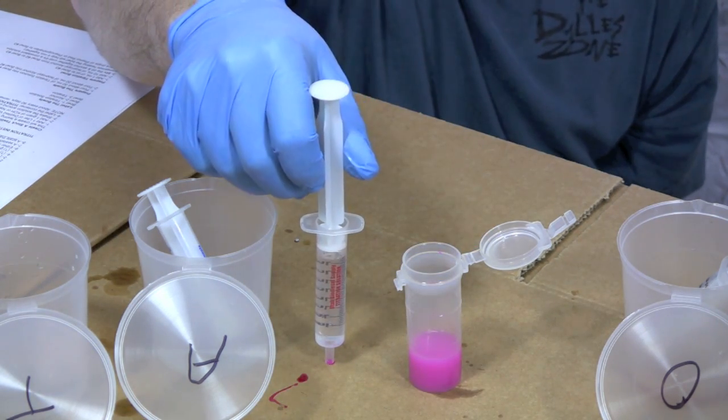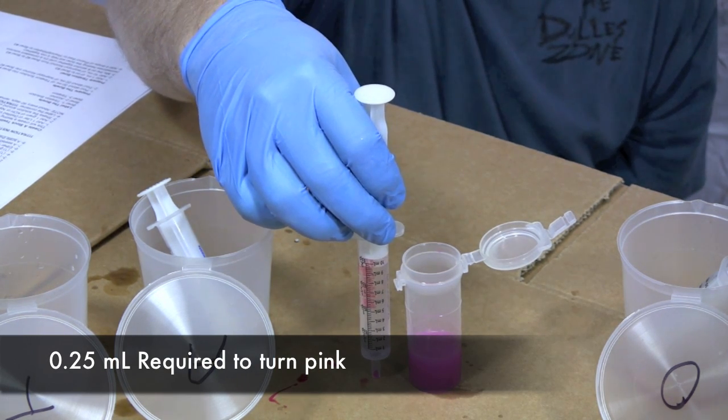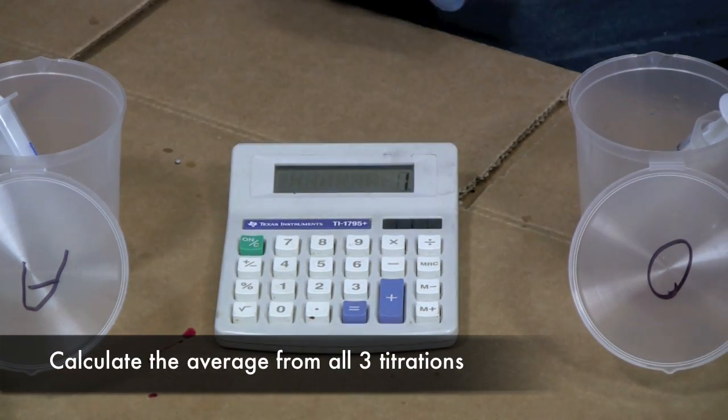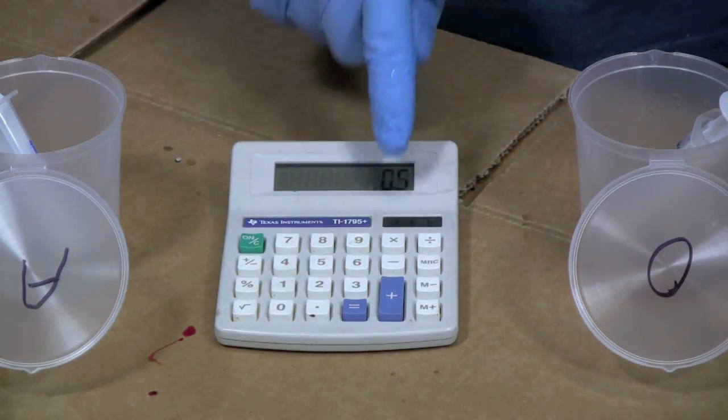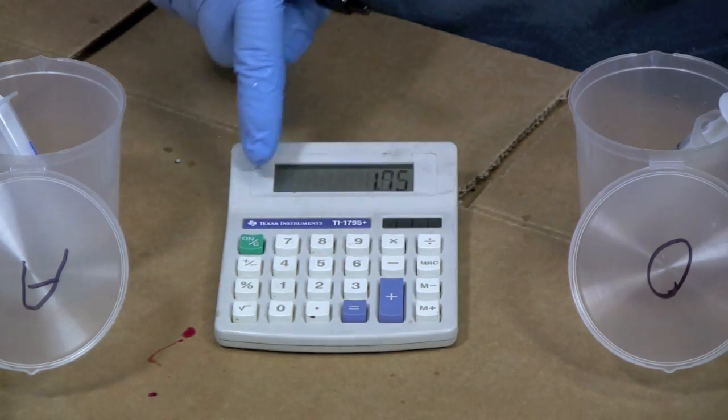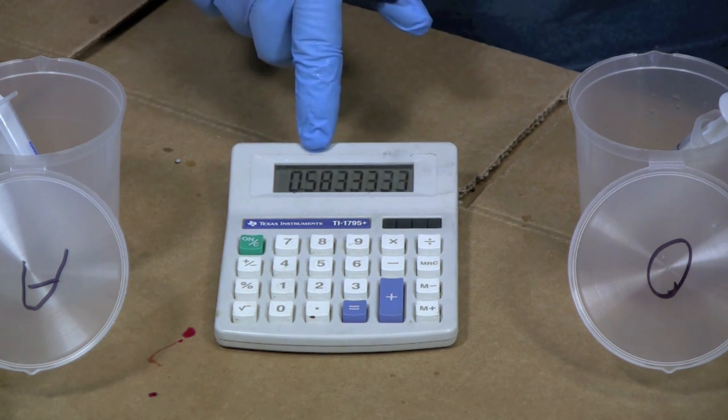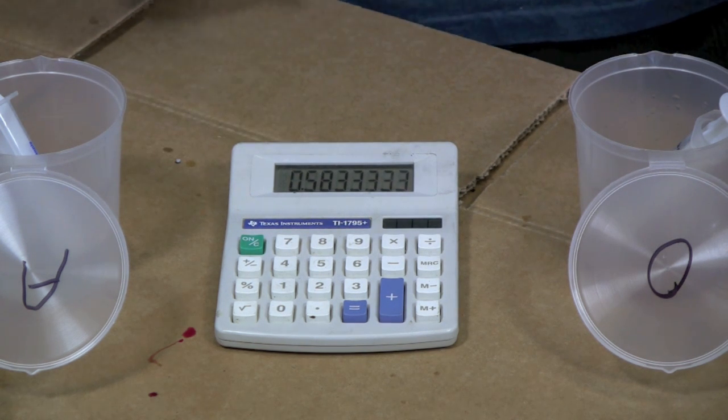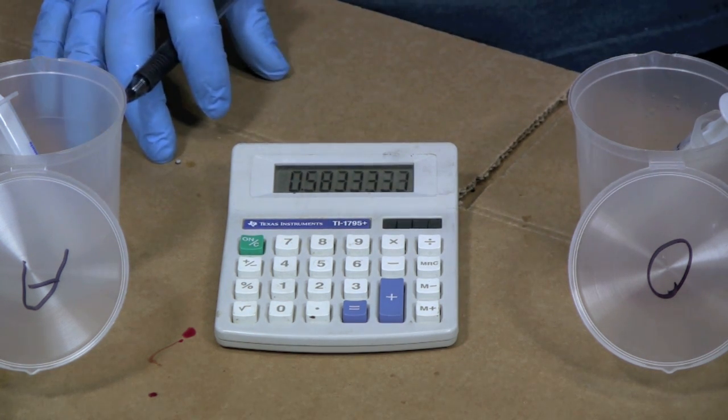We started at 10. We are at 9.75. So this is really good oil. We've done our titration. Our first one was 1. Second one was 0.5. And our third one was 0.25. And we're going to divide those by 3. That means our titration was about 0.58 or 0.59. So I'm going to actually round this up and it was 0.6. So it took 0.6 milliliters of titration solution to turn this pink.